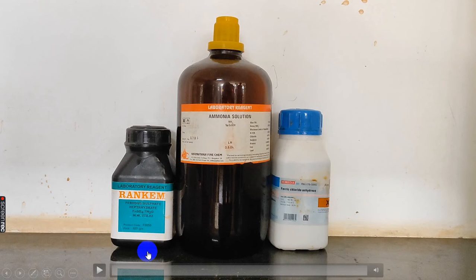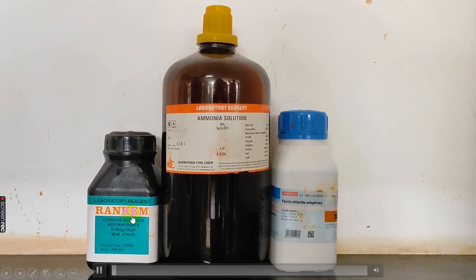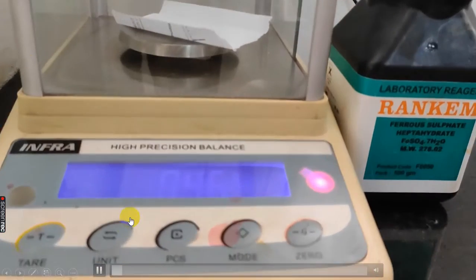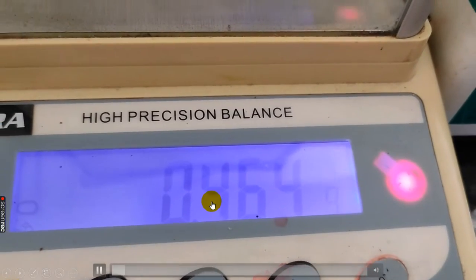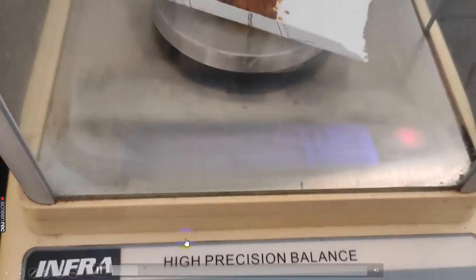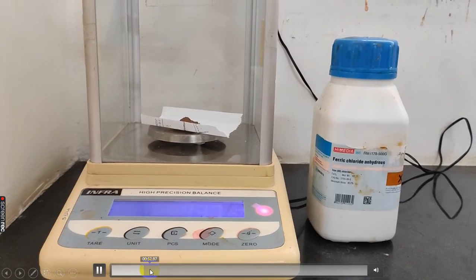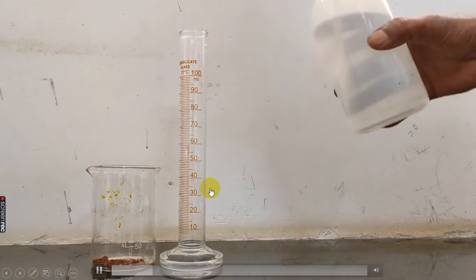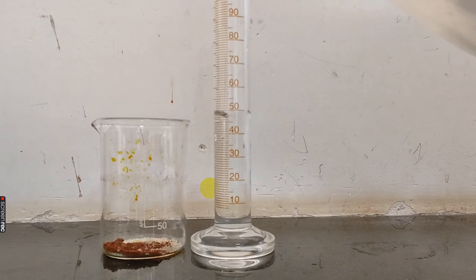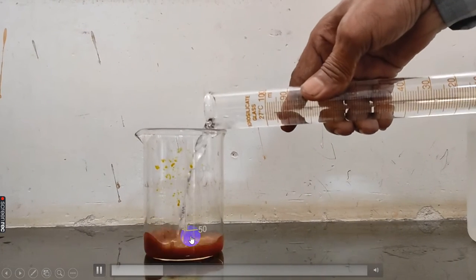Let us have a video demonstration for the synthesis of the same iron oxide nanoparticles. The chemicals required are ferrous sulphate, ferric chloride, and ammonia solution. About 0.4 grams of ferrous sulphate and about 1.4 grams of ferric chloride solution are transferred into 50 ml of deionized water.